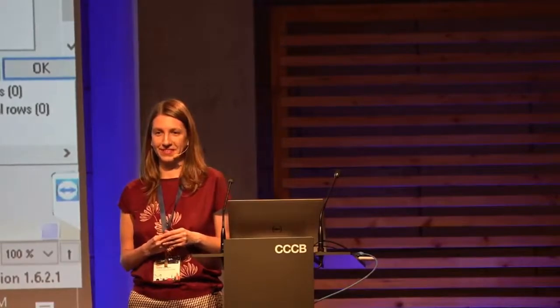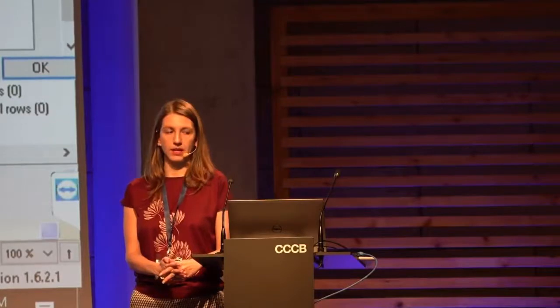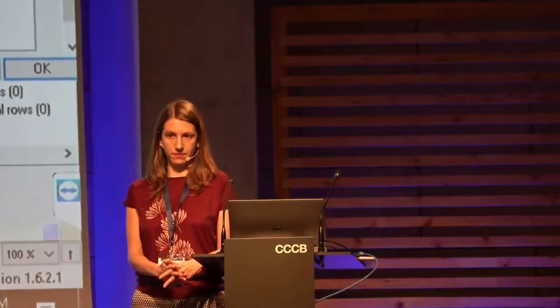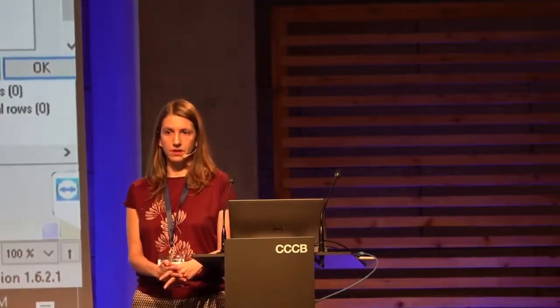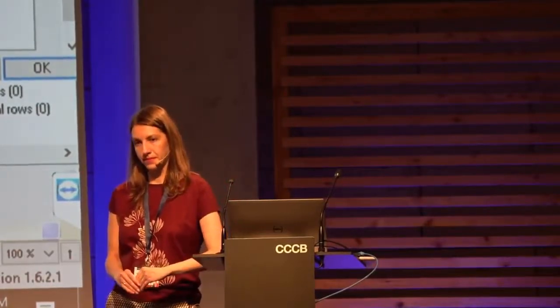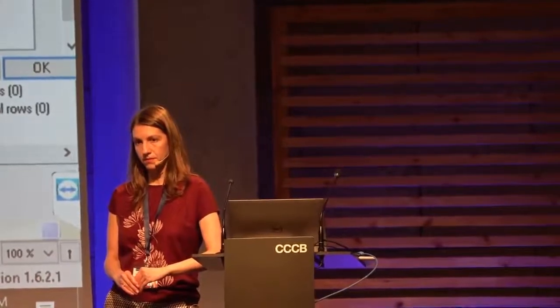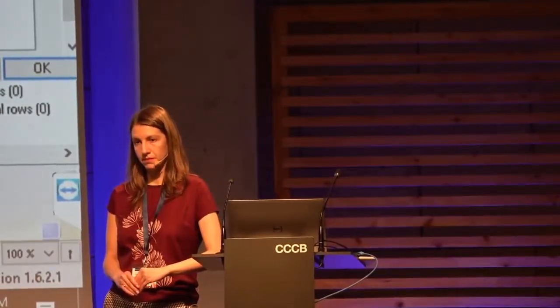Because, yeah, I mean, the K nearest neighbor method is also very popular. And sometimes I feel that it could have been a better option when I look at my data, because you can have intensity values in the range of like 20, 21, let's say, log transformed, and then suddenly the imputed values are like 16. I mean, they're far away from the average if I didn't consider imputations?